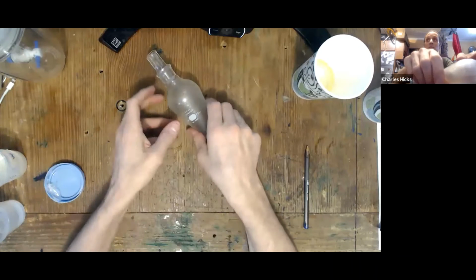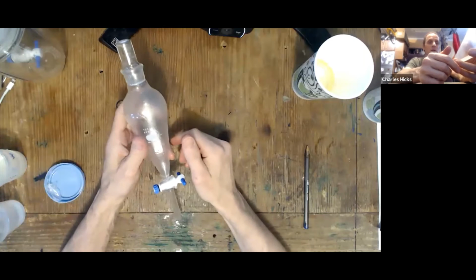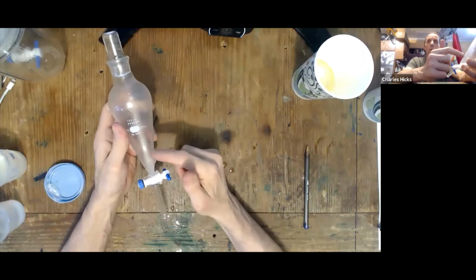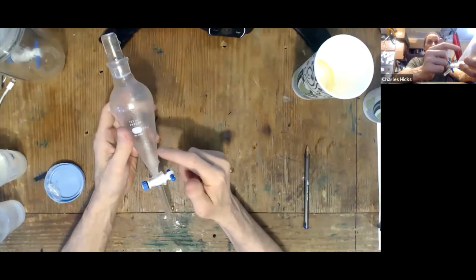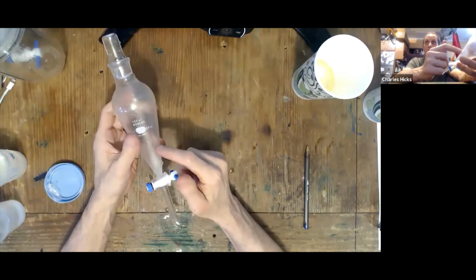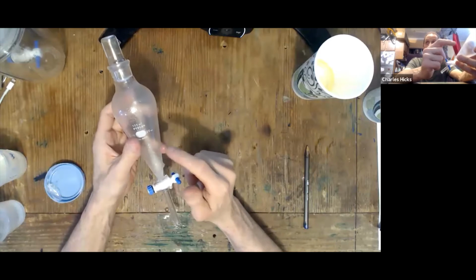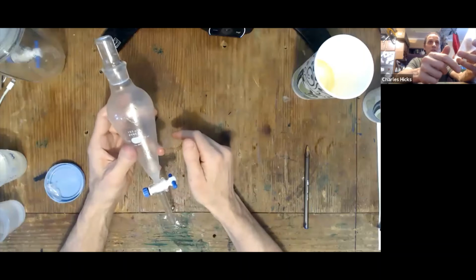The next thing that we have to do is a preparation for next week, which is to mix together a small amount of the canola oil, the water, and the triethyl citrate in this separatory funnel and allow it to equilibrate. That equilibration we want to sit for a week. So we're going to prepare that this week, but we're going to leave it sitting until next week.